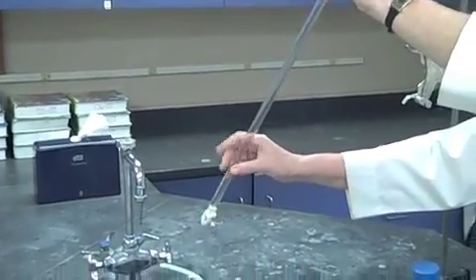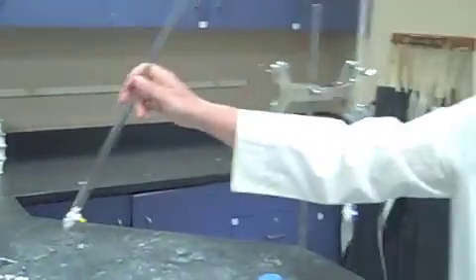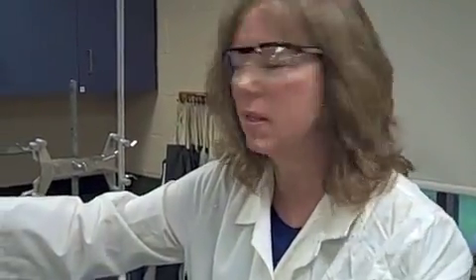Now, depending on the event coordinator's rules, I would say normally three rinses is what you want to do. Since this is a race, I think one rinse is going to be good enough because they are supposed to furnish you with clean burettes to begin with.